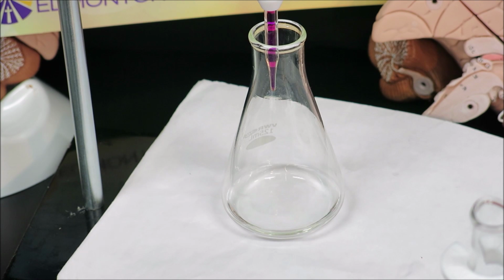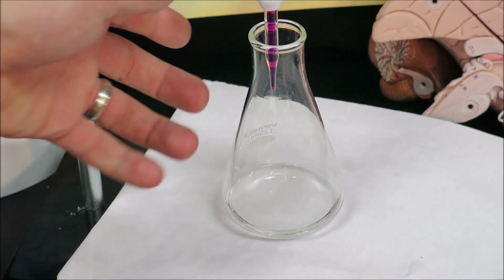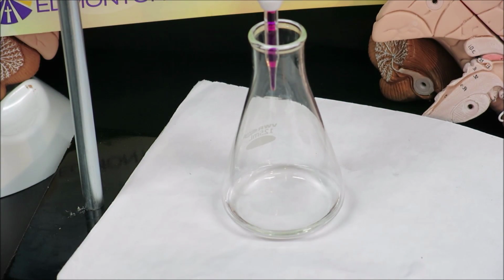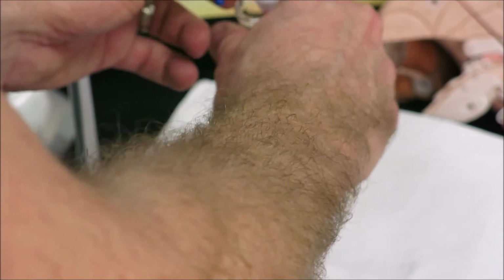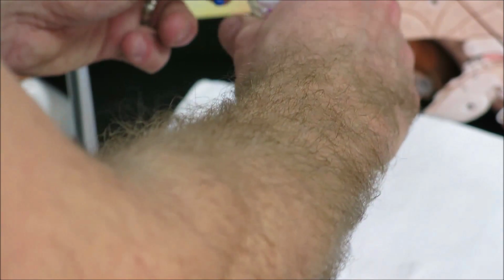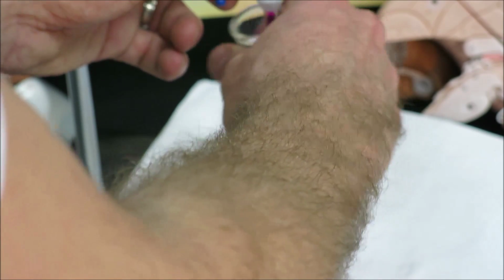So we're going to take our second trial here, as our starting volume is 15.7, and we're going to add in very quickly about 8.5 milliliters, bringing us to 24.2 milliliters, and then we can slow down the remaining parts of the titration. Very important to swirl. I'm sure you could see right at the start the flask went completely pink, but once I swirl, the color will fade.